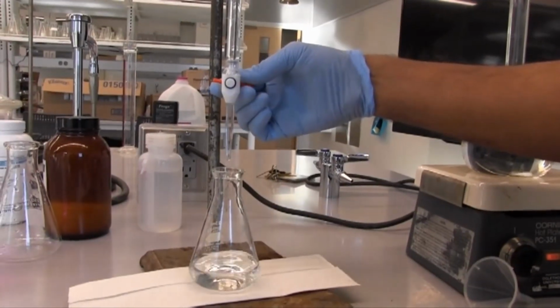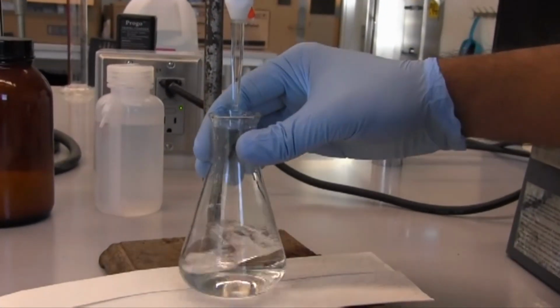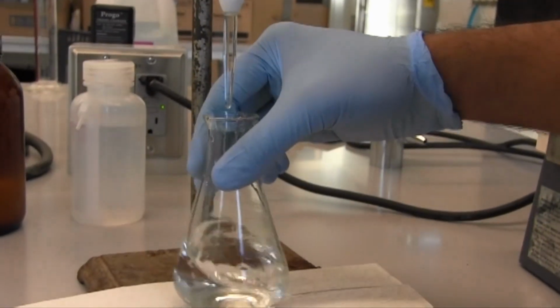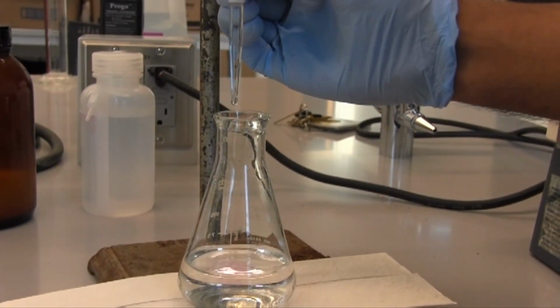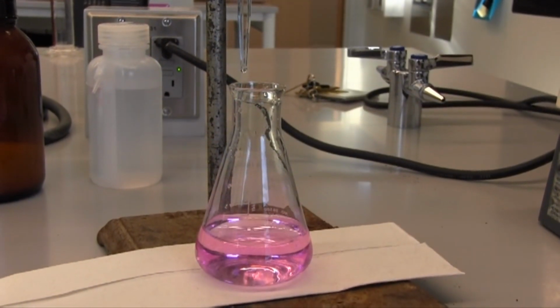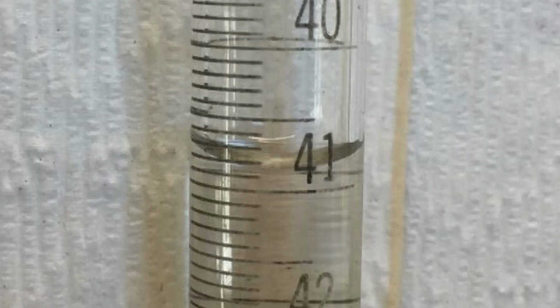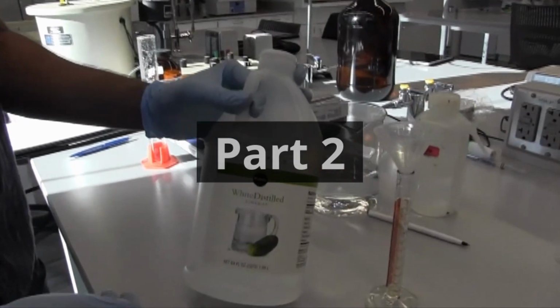We can go ahead and start dripping our sodium hydroxide into our KHP while swirling to make sure that everything is homogenized inside of this Erlenmeyer flask. Now, as we get closer to the endpoint, we'll slow the drip down. Keep on swirling, and there we go. Here's our endpoint. You see that nice color there. And our final volume of sodium hydroxide right there. Make sure to write that down. And now we can move on to part 2.